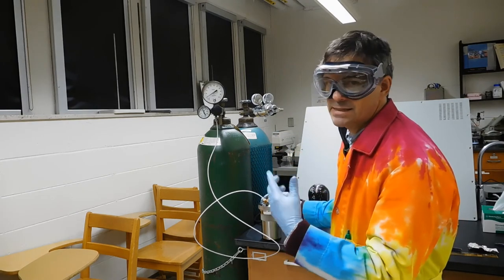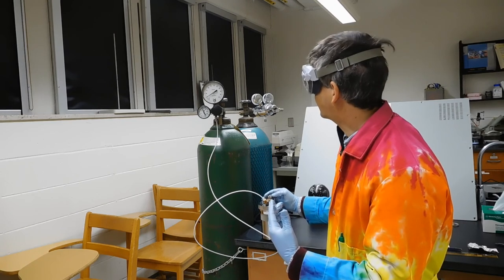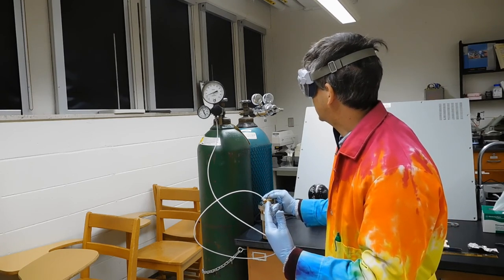While this is open, the pressure rises at a reasonable rate, and it's easy to shut things off. So this fill, we won't have to release again.